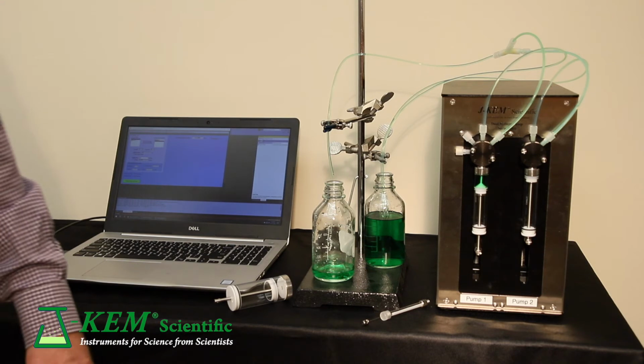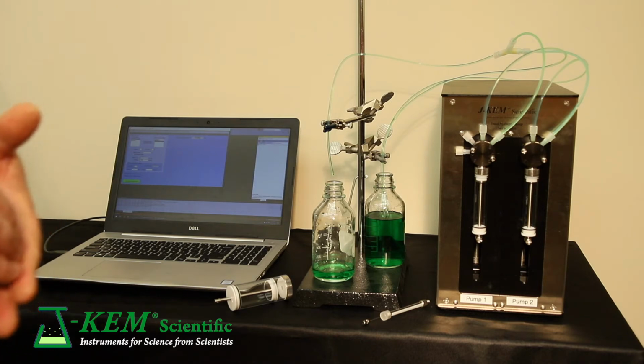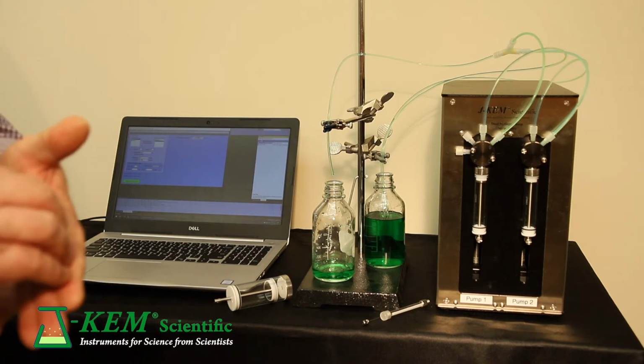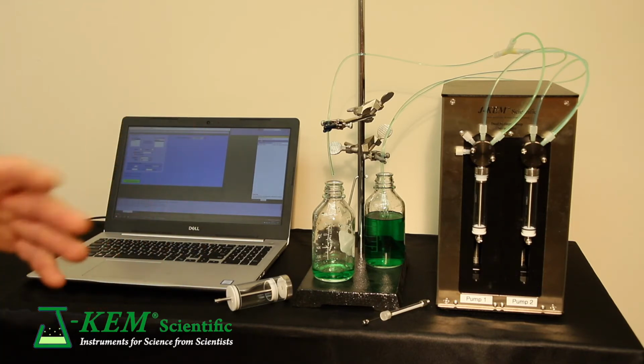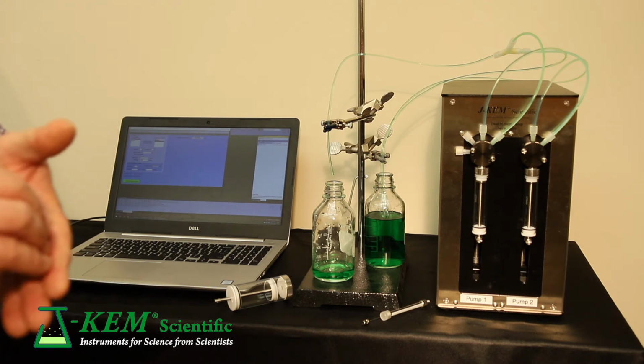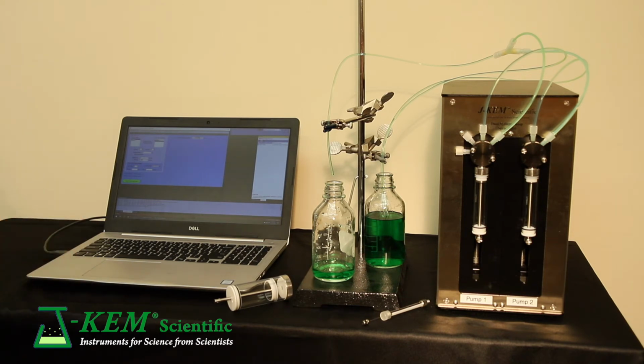In most cases, that's not really important. For example, if we were dispensing at a rate of 1 milliliter a minute, which might be a little more practical, then you would deliver for 10 minutes at 1 milliliter a minute. The syringe would then have to stop for about 6 seconds. It usually takes 4 to 6 seconds to fill a syringe. So it would stop for those 6 seconds while it refilled. Then once it was full, it would resume its delivery.